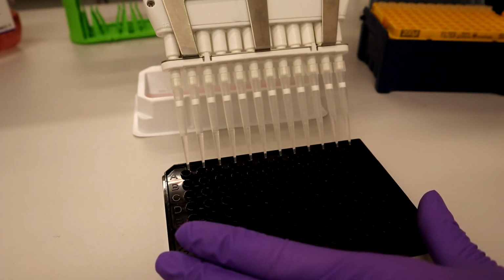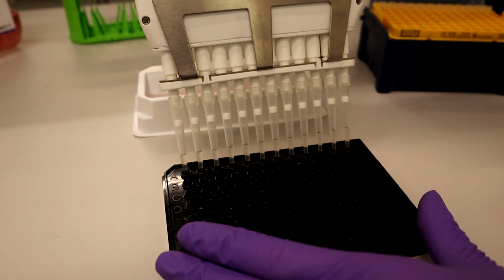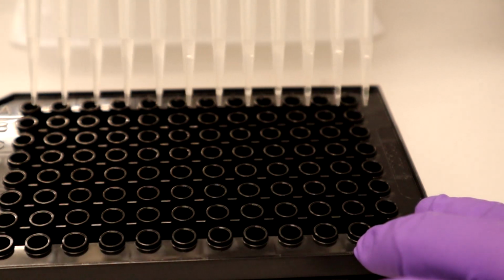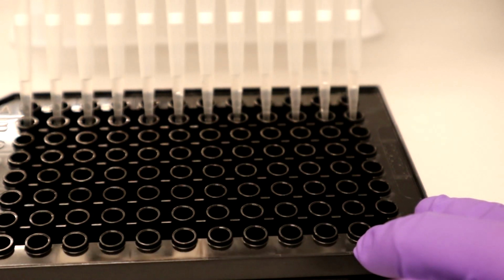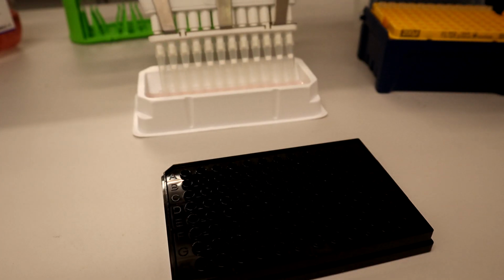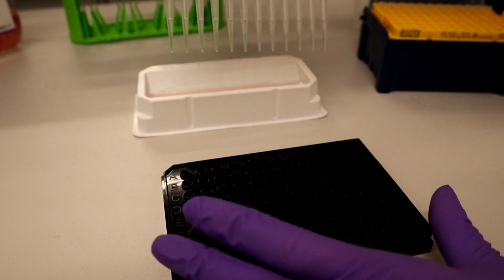Putting the pipette tips all the way to the bottom of the well this time, mix the 60 microliters of clone culture medium with the 60 microliters of standard, which is already in the well. This should be done via aspirating and dispensing 3 to 4 times using the multi-channel pipette. Pipette as gently as possible during this step to avoid introducing bubbles.